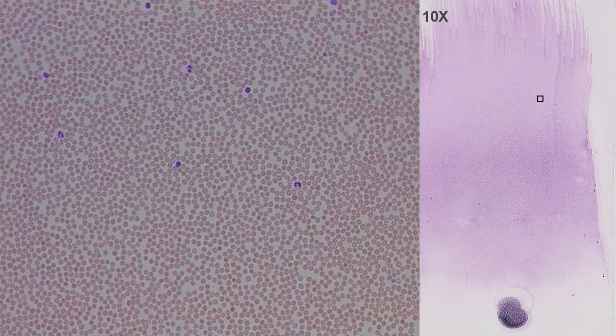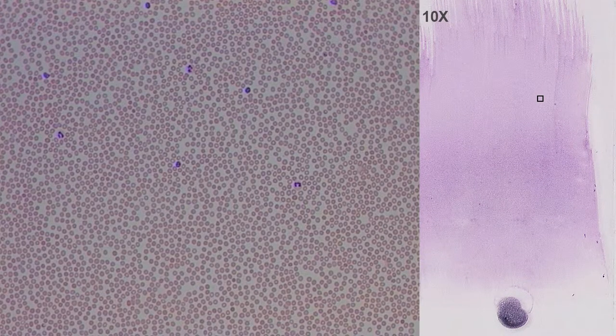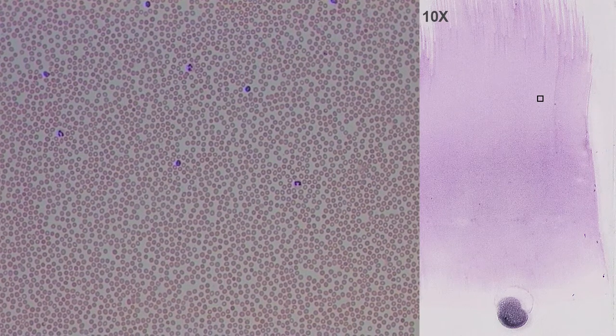As we scan the sample in the direction of extension, the concentration of cells will decrease. The optimum area will be the center or body of the smear. The cells are more separated, and the actual coloration acquired by the blood smear can be seen with Giemsa staining.